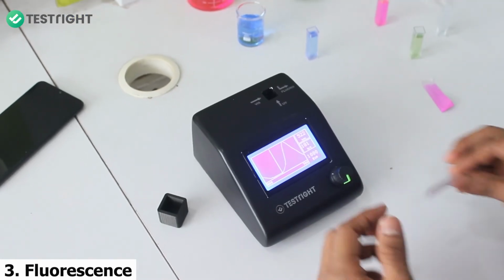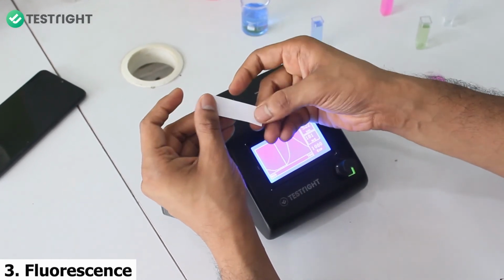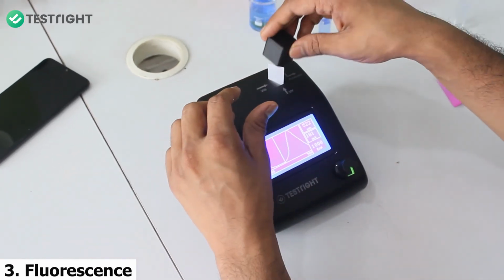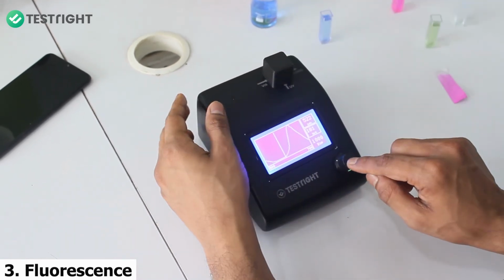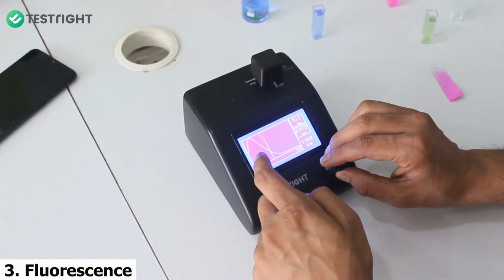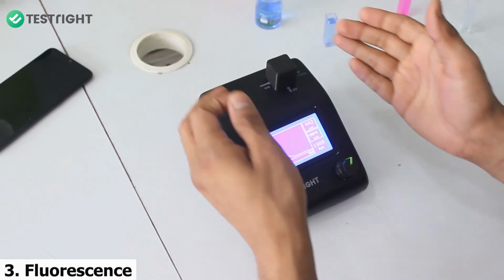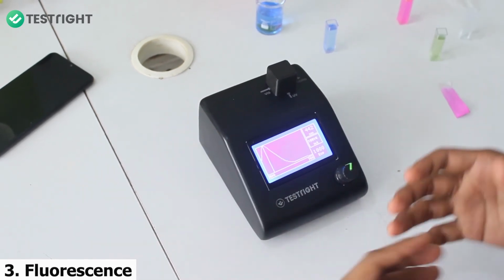You can also take the fluorescence of the solid strips, just like this paper. I'll put this paper in and look at the optical brighteners which are used in the manufacturing of these papers. I'll cover this with the lid and look at the fluorescence. You can see that the fluorescence has shifted towards the bluer region. This is exactly why the optical brighteners are used in manufacturing of the paper, to make it look more whitish.